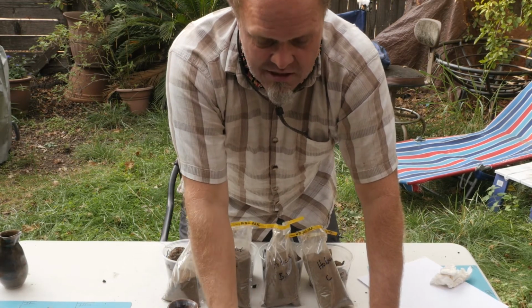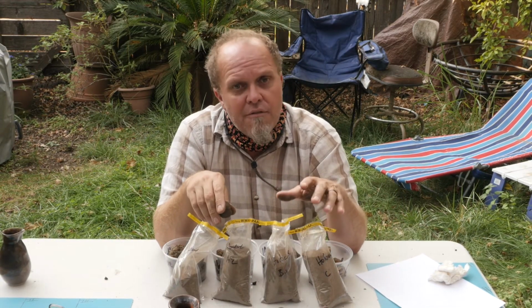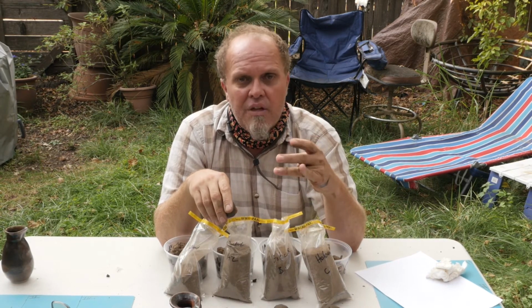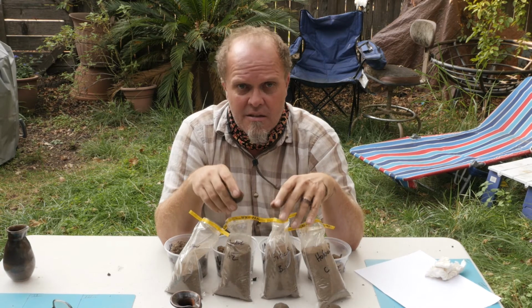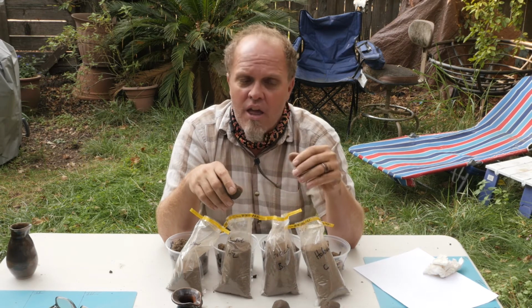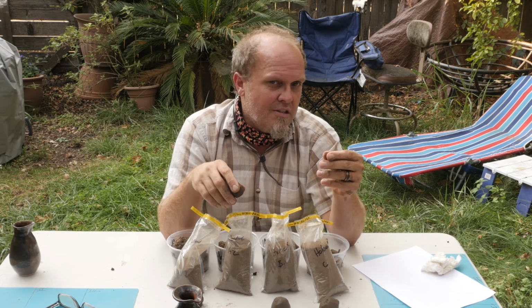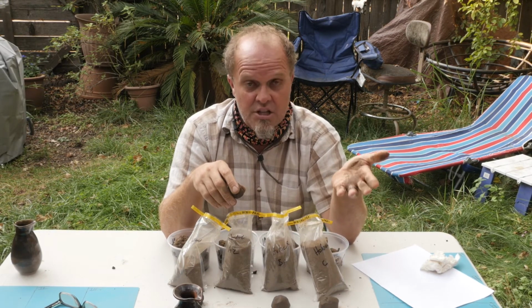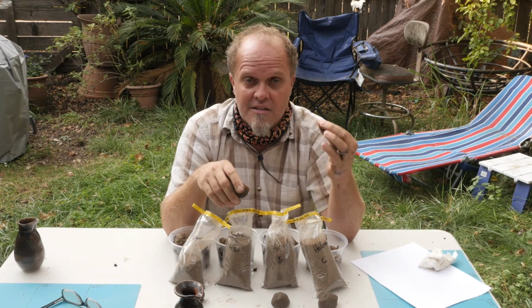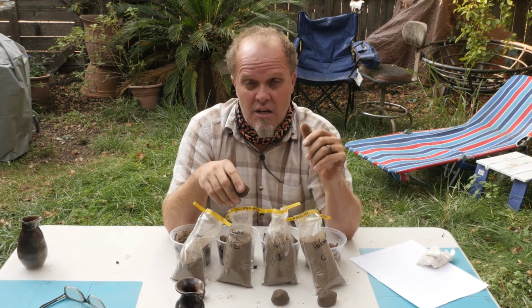Now, what happens is you learn about doing this in a class and you do it once or twice. You really never learn about these things until you get a lot of experience and a lot of practice, and work with people that have very calibrated hands. You can work with an active soil scientist like Andrew Conlon here in Chico, and you hand him something and he's spot on. He can take his assessment with his fingers, check it versus legitimate lab data, and he's always going to be within a percentage or two of the actual numbers because he's textured tens of thousands of samples across his career. So he really knows what's going on.